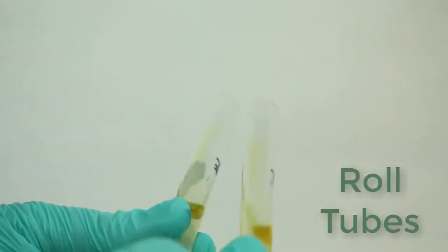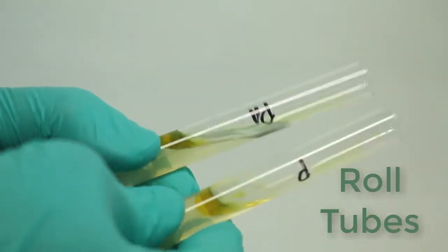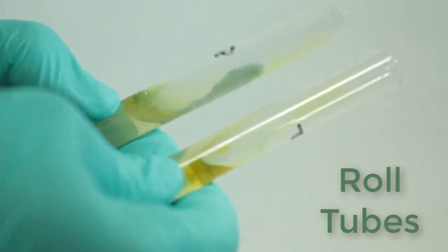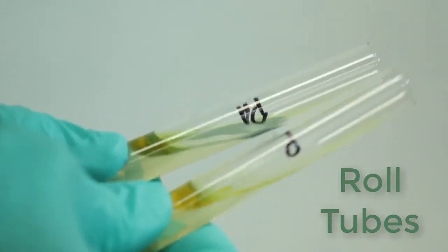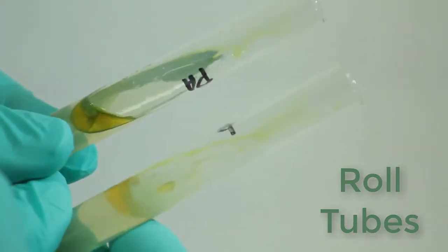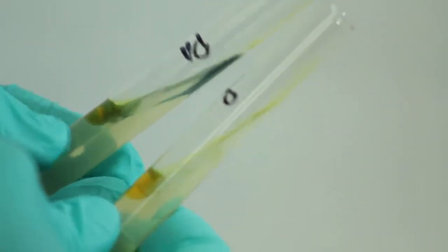As you have the reagent on the slant, you want to roll that reagent back and forth across the slant and wait for a reaction.